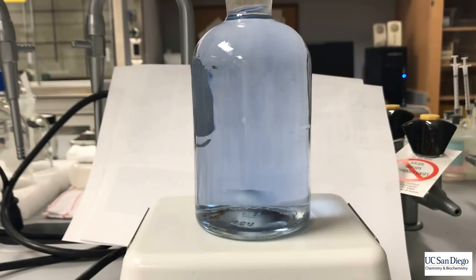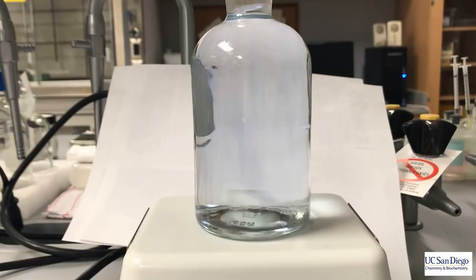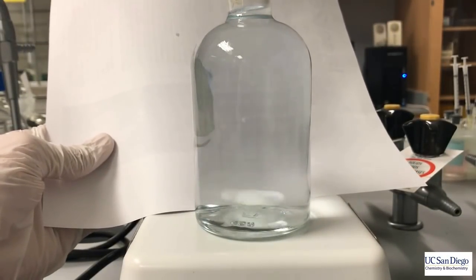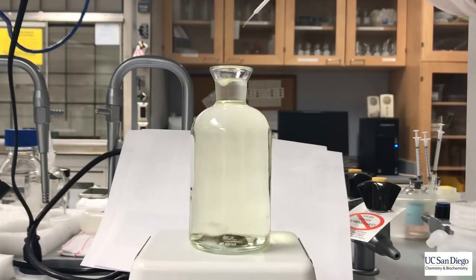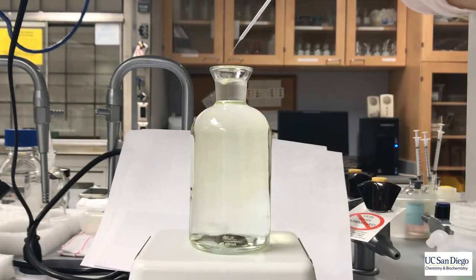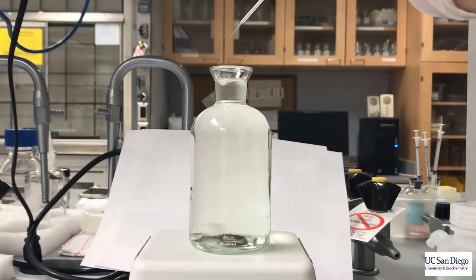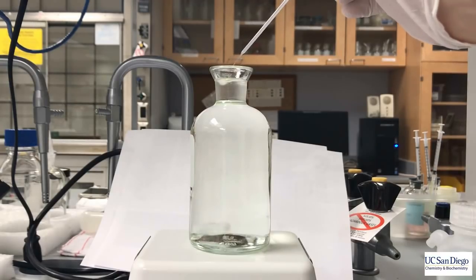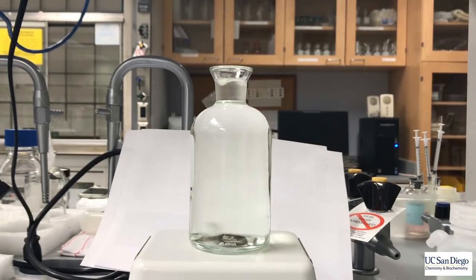To visualize the end point, using a piece of white paper on the back can help, as well as the label on the BOD bottle if you orient it in such a way. Now make sure that you weigh the pipette when you're finished. The iodine color makes it very difficult to visualize the end point because of the low absorptivity of iodine. So when doing this titration it's hard to be certain when you've reached the end point, whereas having the starch in there makes it simple.